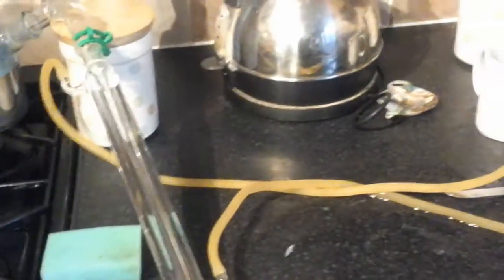My cold water supply, which is topping up on a fairly regular basis, runs as a siphon through the condenser down into the sink. I've already disposed of the first failed batch, which is probably going to block the sink if it doesn't eat its way through the pipe entirely.